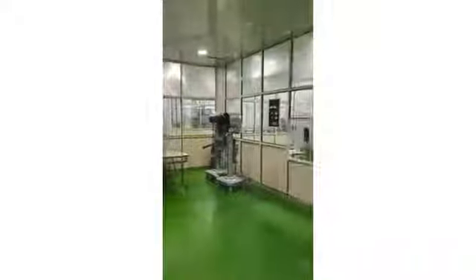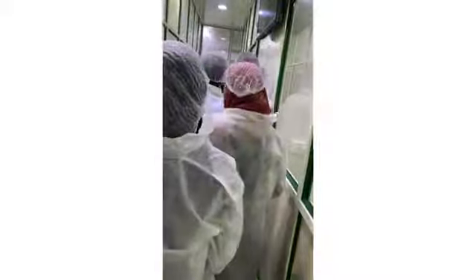The primary packing: primary cap and capping machine. We have two capping machines. The inner cap is put first, and then the outer cap. Then the seal happens. Here, that machine does shrinking, primary packing, and secondary packing, and it goes to the godown. Once it is packed completely with the outer shrink, it goes to our FG godown.